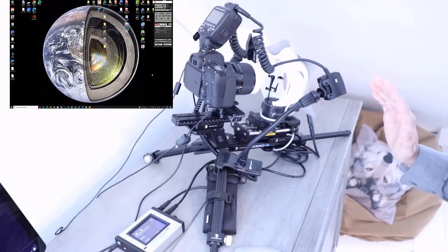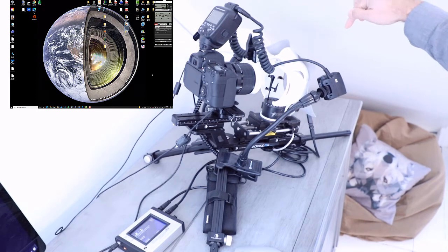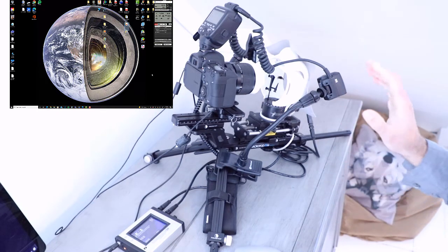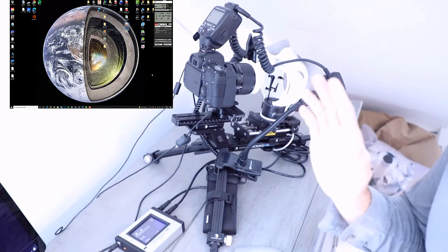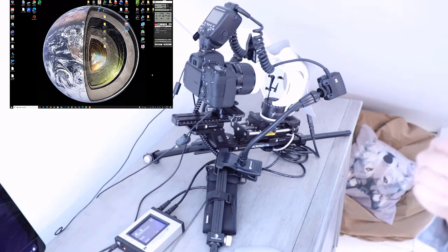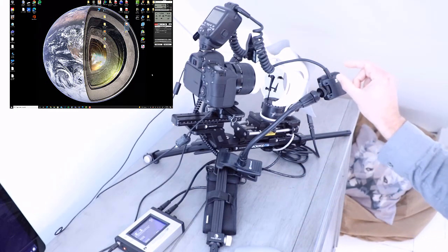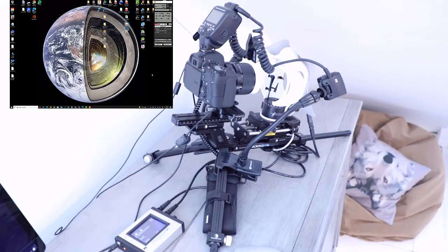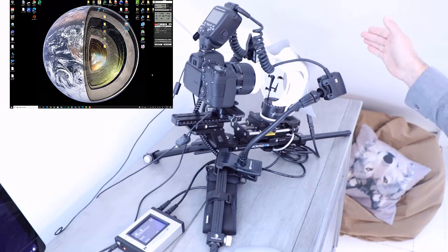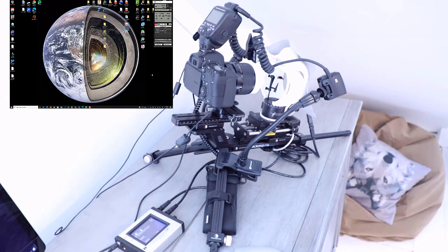Okay, so the image capture is now completely done through a 240-degree section of the sample. What we want to do now is begin to separate out and batch process all of those images, but at the same time, it might be a good opportunity to now capture images of the other side of your sample. It's not completely likely that you'll need the other side of the sample, but more data is always going to lend itself into a more accurate 3D model.